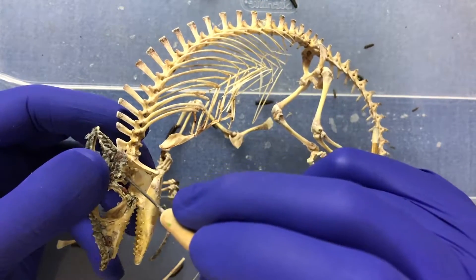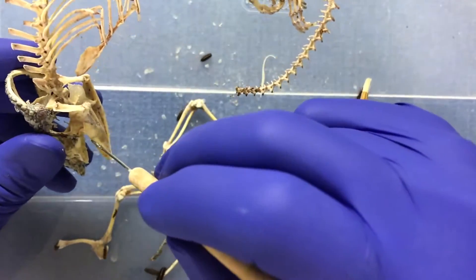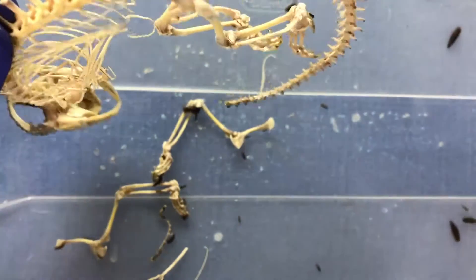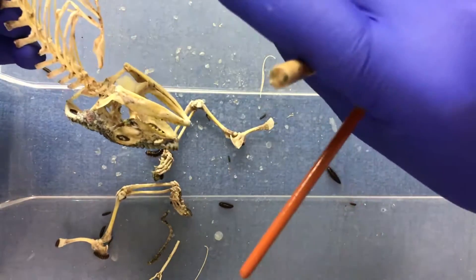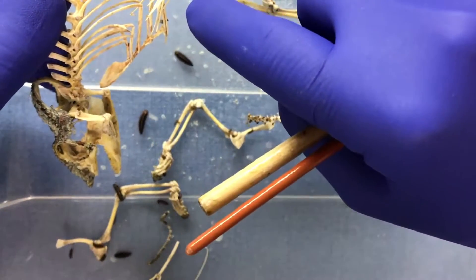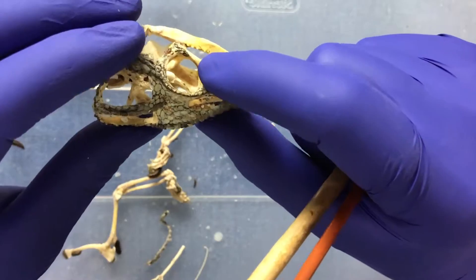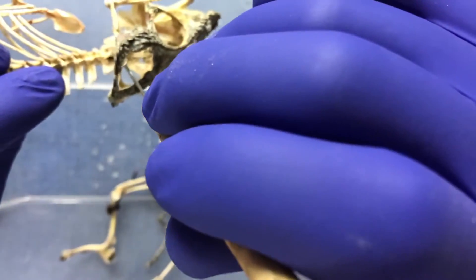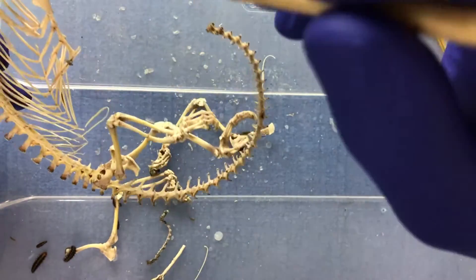You try to evict these guys by giving them a little gentle nudge — the pointer comes in handy for that. I would love more than anything to run a wire up the spine to save as many individuals as I can, but this skeleton is in such good shape coming out of the beetles that I'm really going to try to preserve as much of it as possible — even the cartilage, which a lot of reptiles and amphibians have with their skin very closely invested with the actual skull bone.